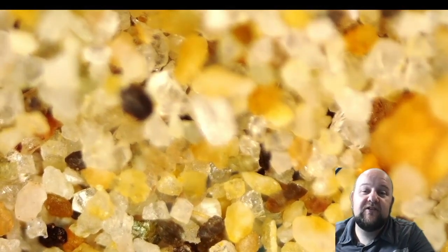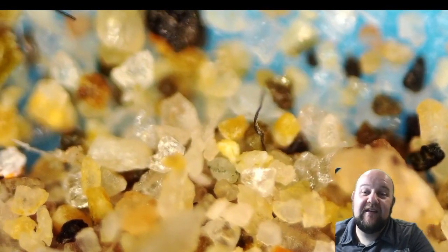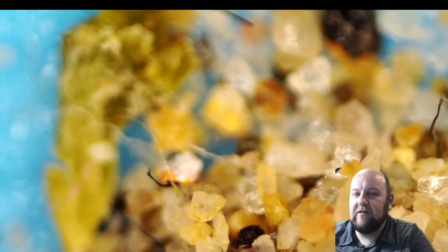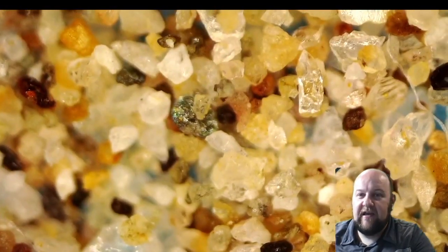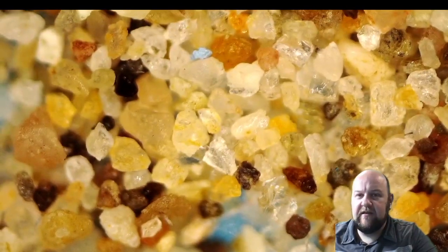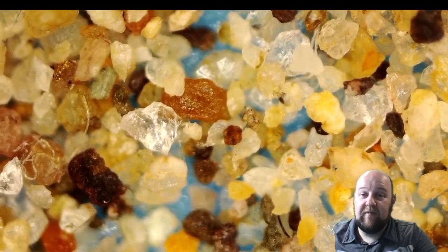I'm gonna look real quick. I'm not seeing it. I do have some other footage that I'll share, but what I saw on the sand, we found like a mite, like a dust mite of some sort on the beach sand. I don't know if it came from the beach sand or from my office, because after I did the laundry, I thought, oh, let's go put that on my desk where I filmed these, and left it there for a couple days. That was a couple days ago, I think, maybe 1 or 2 days, and that dust mite could have just come from the office.